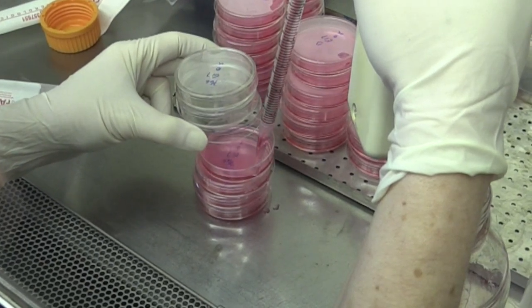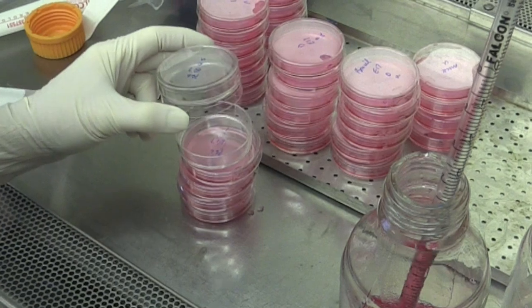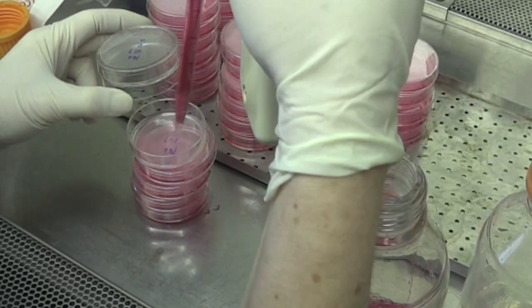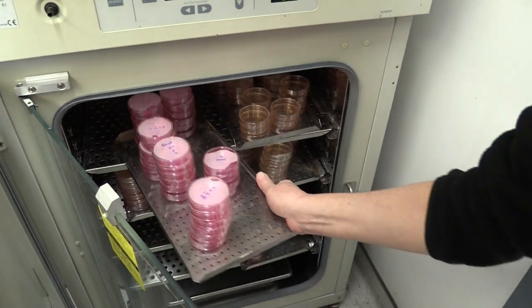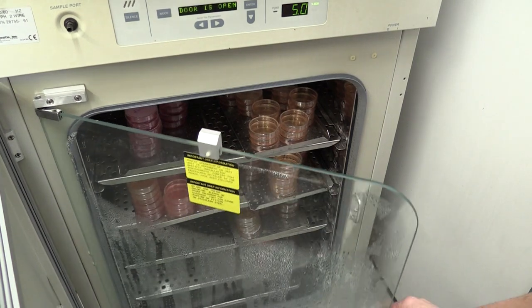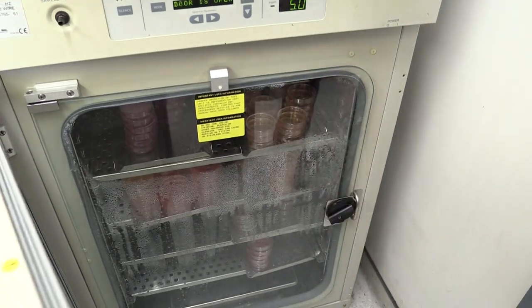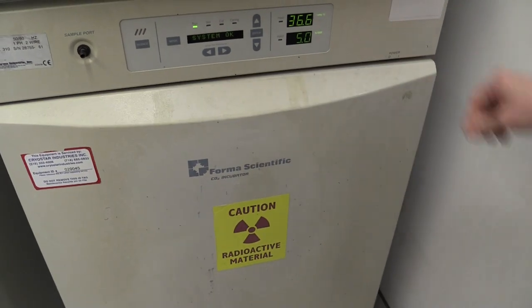The plates are left at room temperature in the cell culture hood until the agar solidifies. Then we place them in the 37 degrees Celsius incubator. This incubator contains 5% carbon dioxide, which acts to maintain the pH of the cell culture medium, which contains a carbonate buffer.